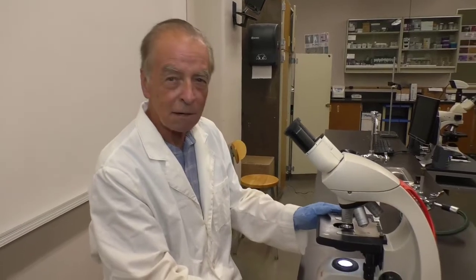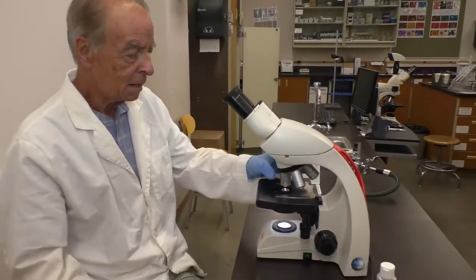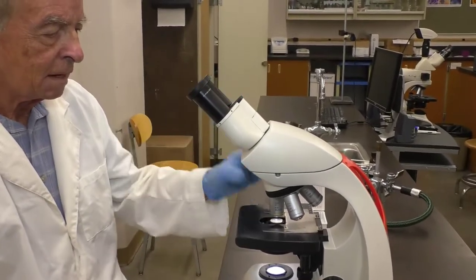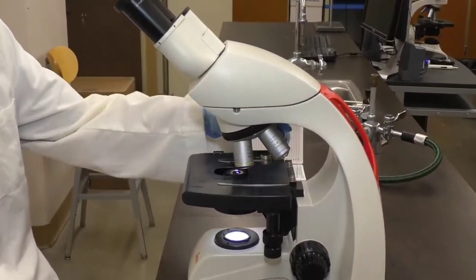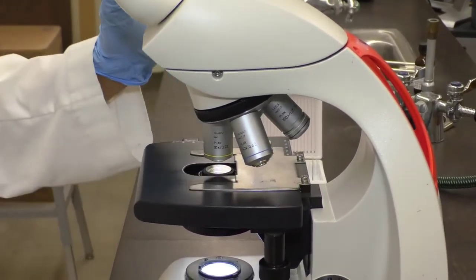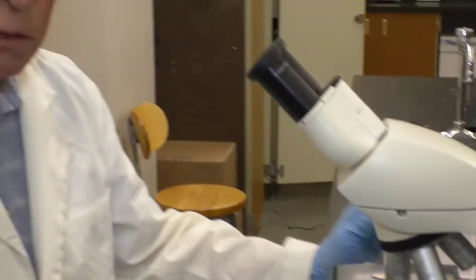Today we're going to talk about your microscope. Let's briefly review the parts of the microscope. These are compound microscopes, so you have your ocular and your revolving nose piece with 4 objective lenses. What we want to focus on today is use of the oil immersion lens in viewing bacteria, because basically you need the oil immersion lens to view bacteria.